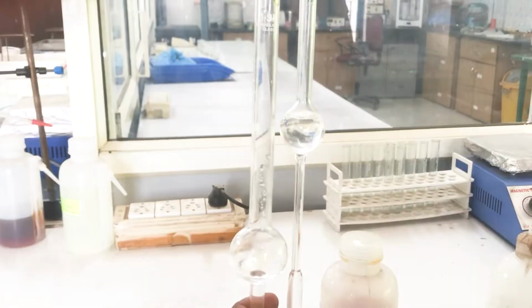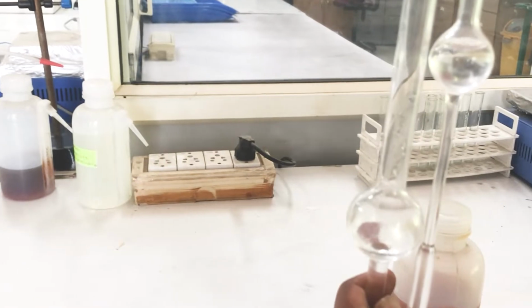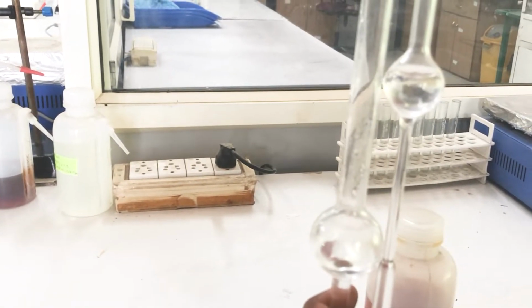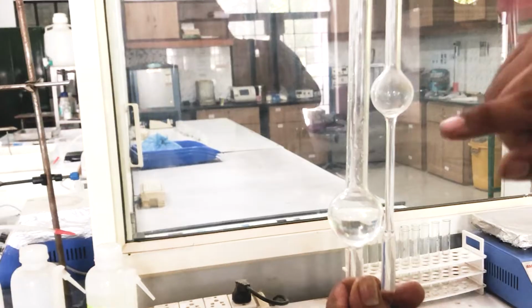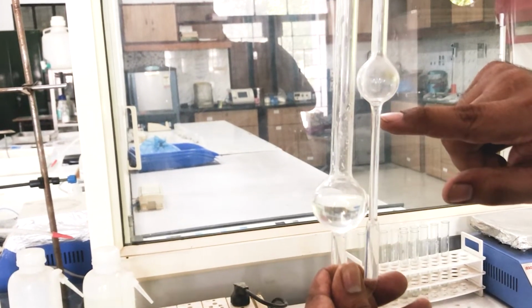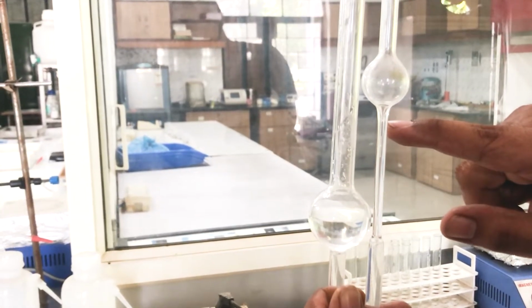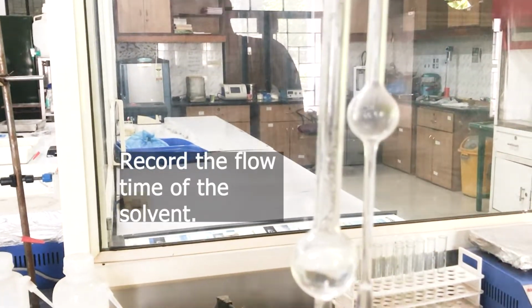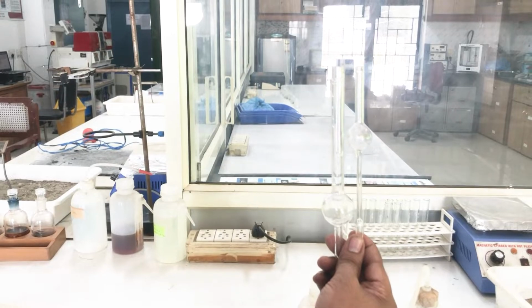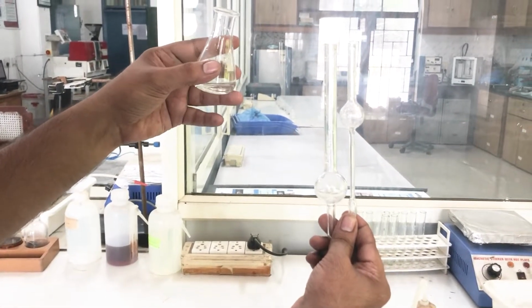Let the solvent flow to the right end of the viscometer. Now as you can see, we stop the stopwatch when the solvent reaches this mark. Now we'll be adding our polymer solution of 0.2 gram of polymer into the viscometer.